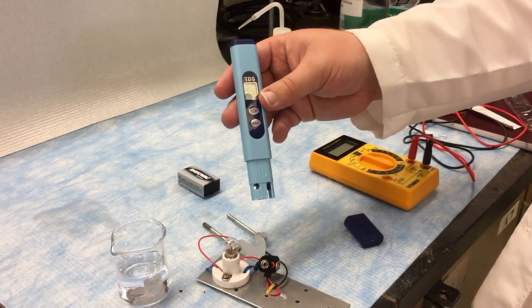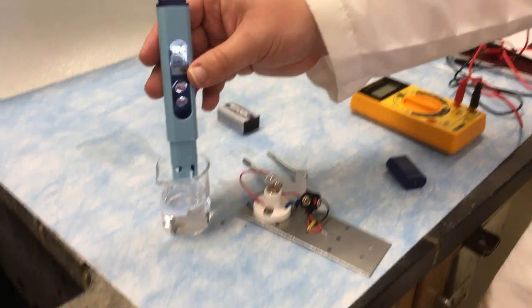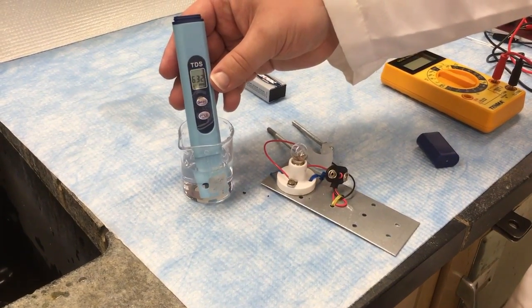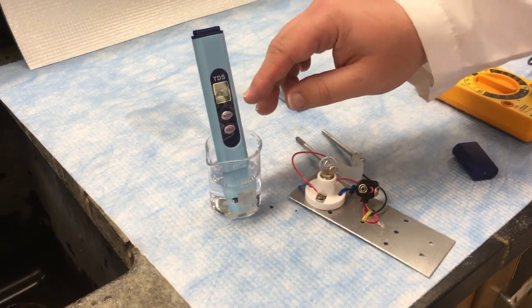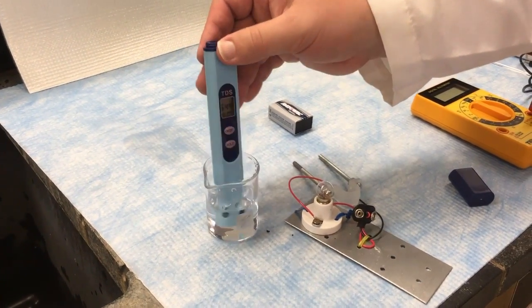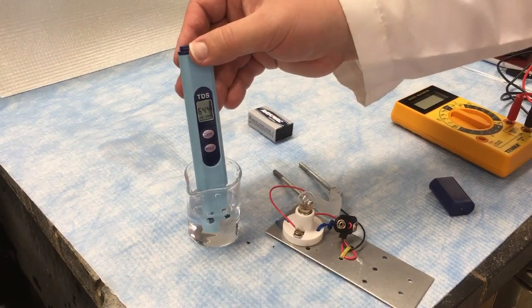We're just going to see what kind of measurement we can take of a conducting solution here. So I immerse the tips and you can see it starts reading 63, oh there we go, 74, 754. It's flipping around. We'll let it come to equilibrium.